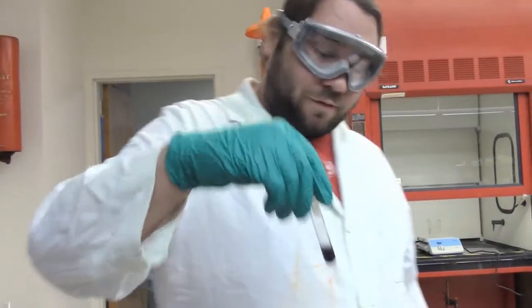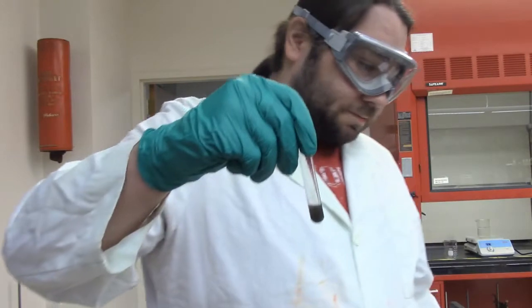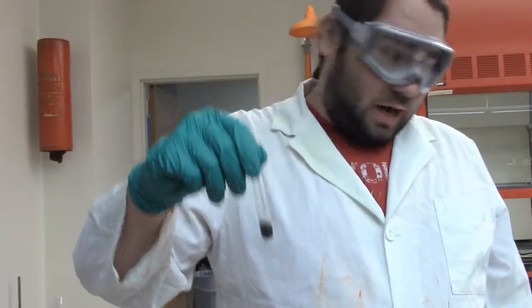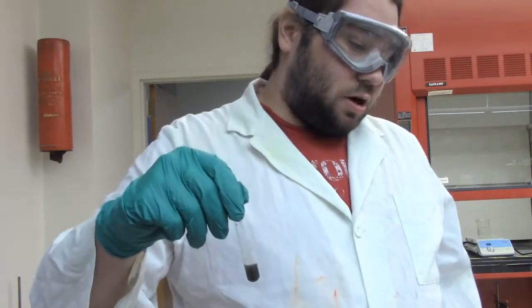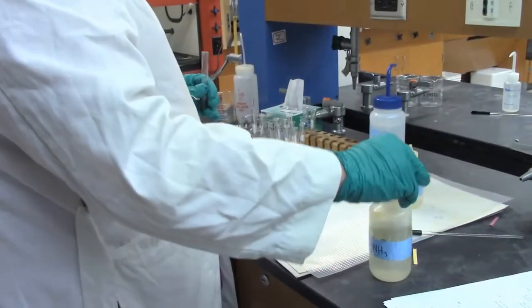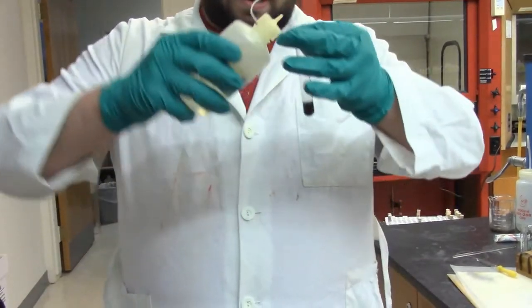So, now that we've finished our test for cadmium, I have our precipitate from before, which I have suspended in a bit of water. And we are now going to test this for copper and bismuth. So to start, we're going to add 10 drops of our 6 molar nitric acid, which I found right away this time. Go me. So I'm going to add this.